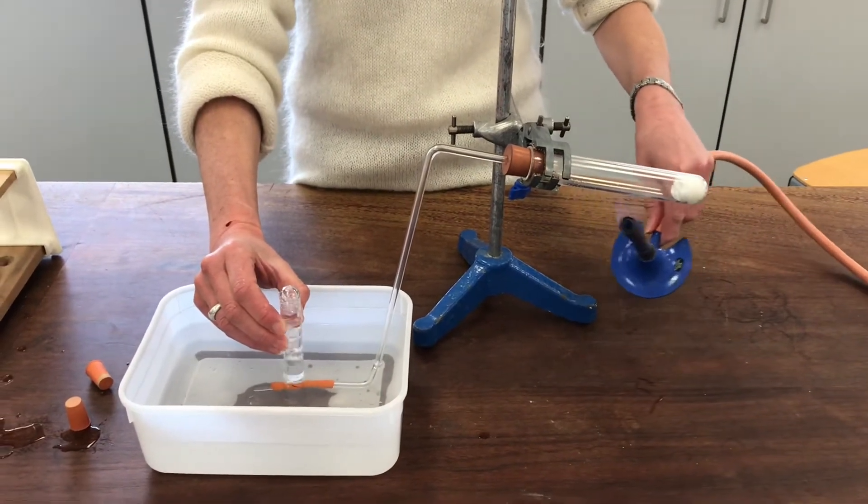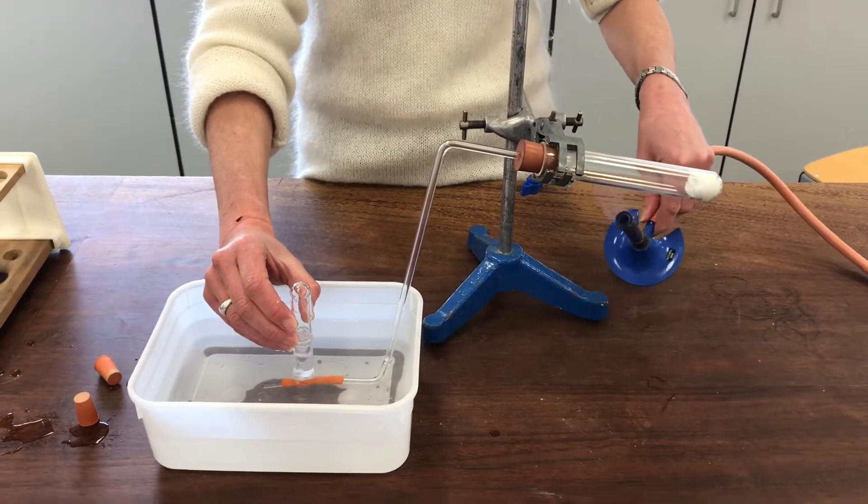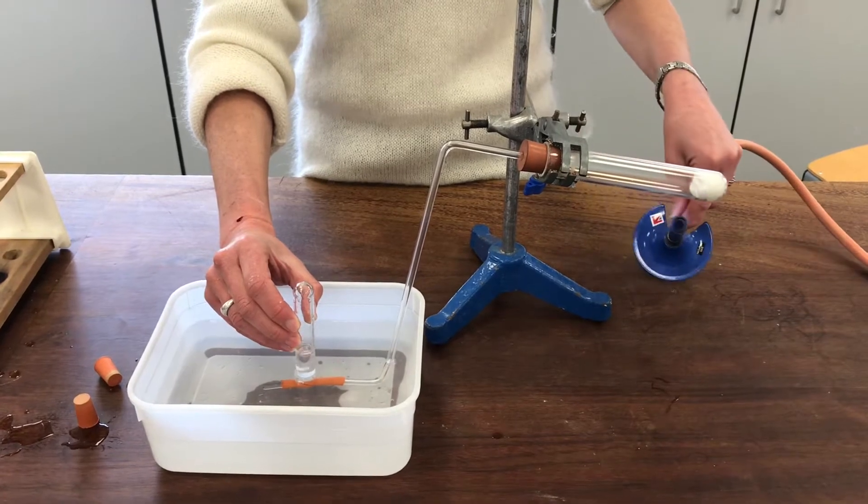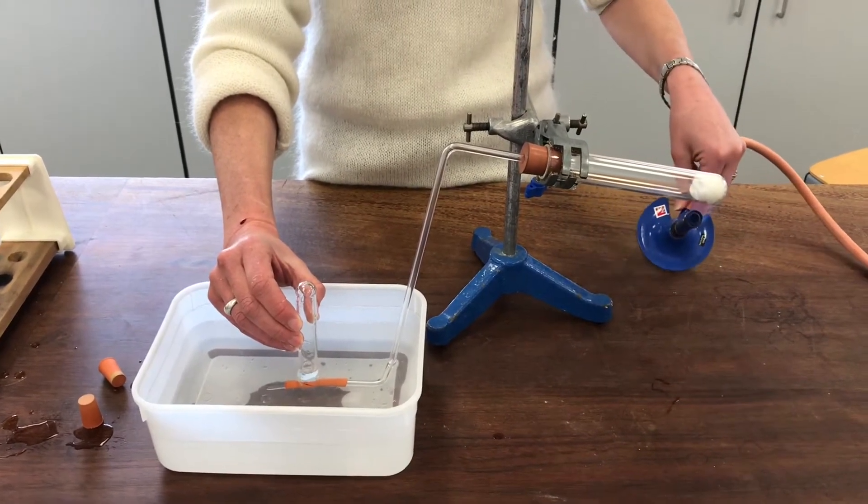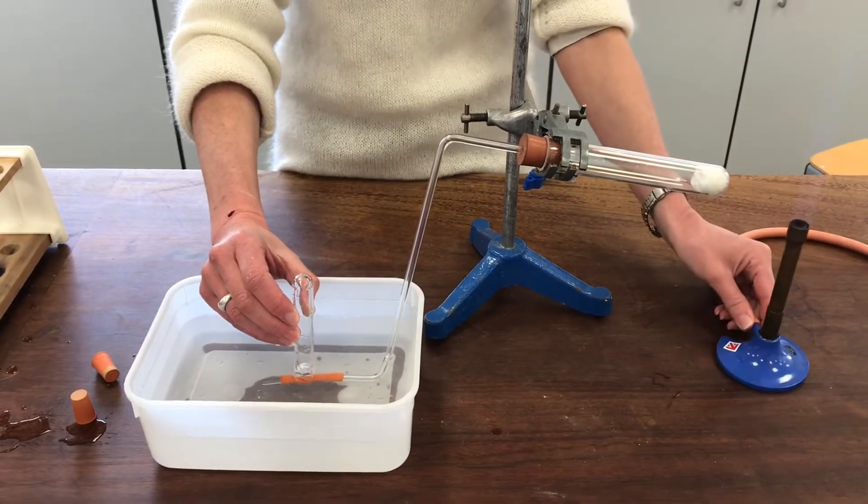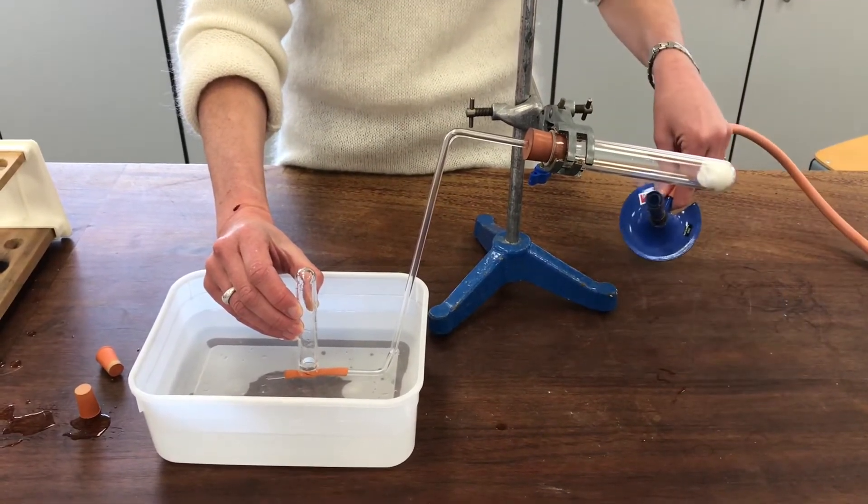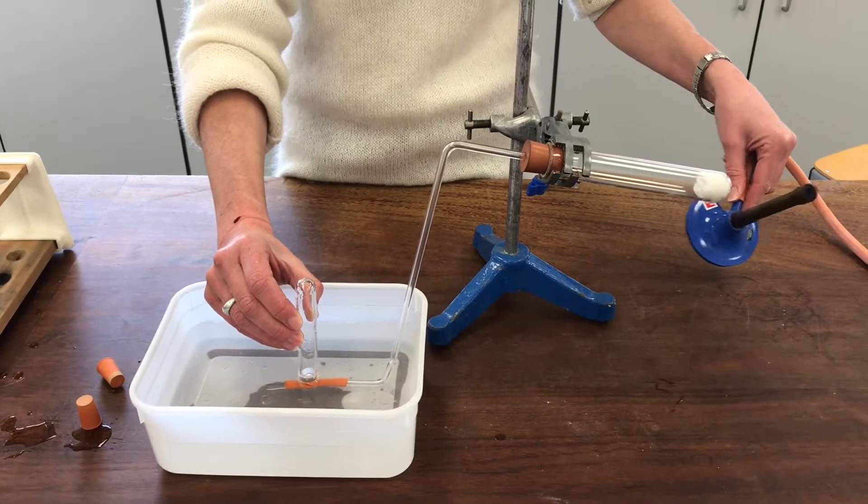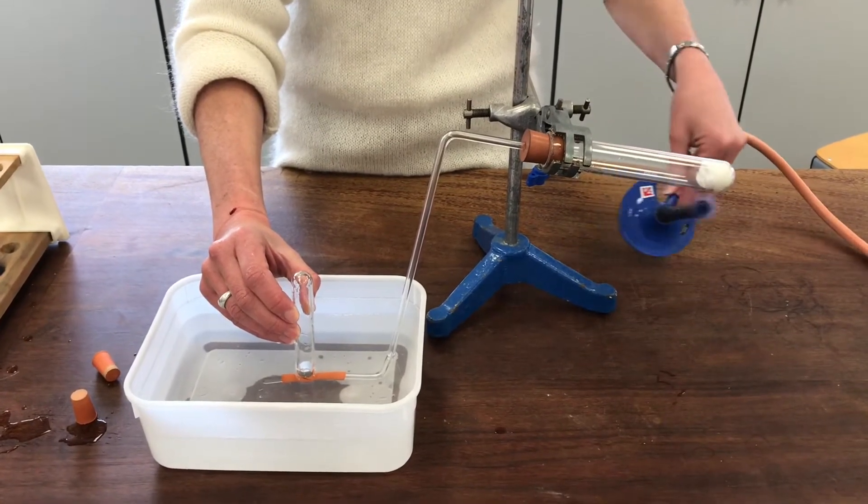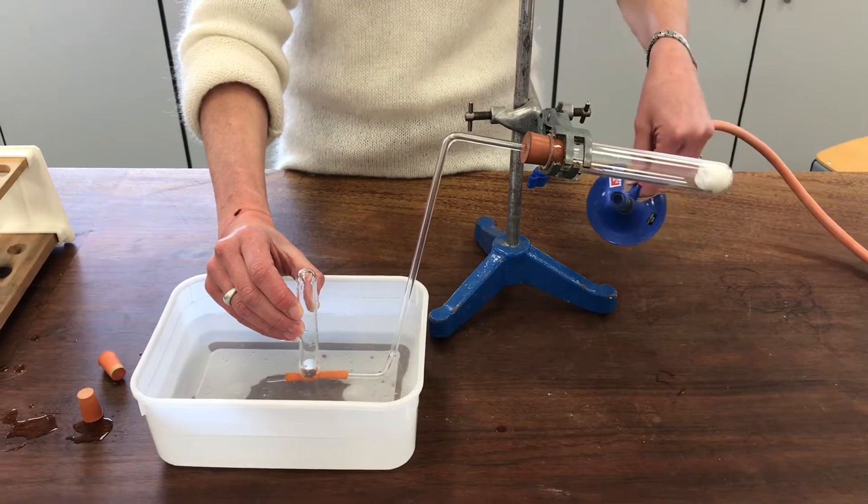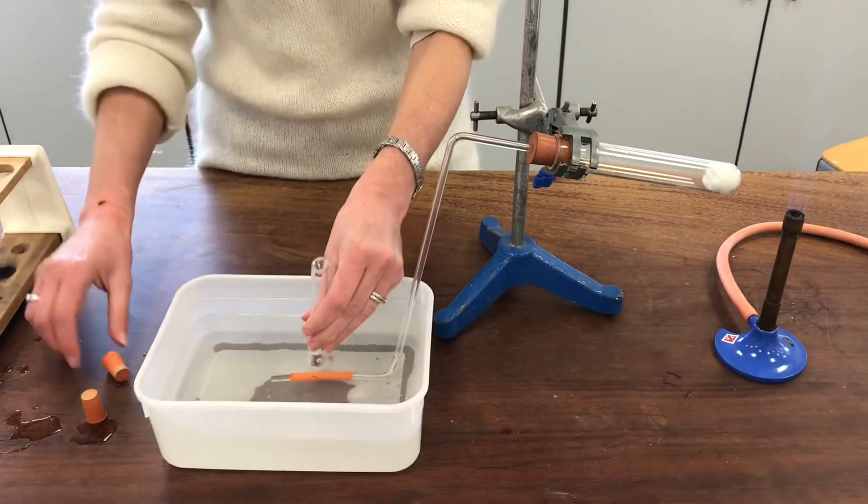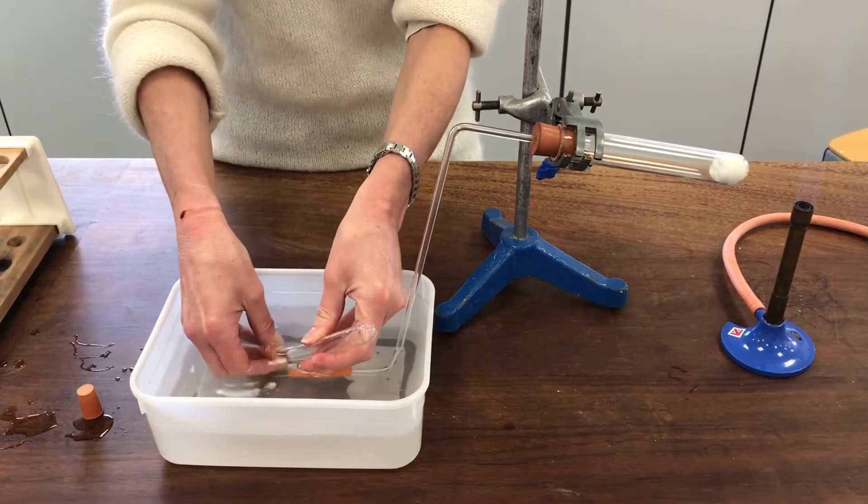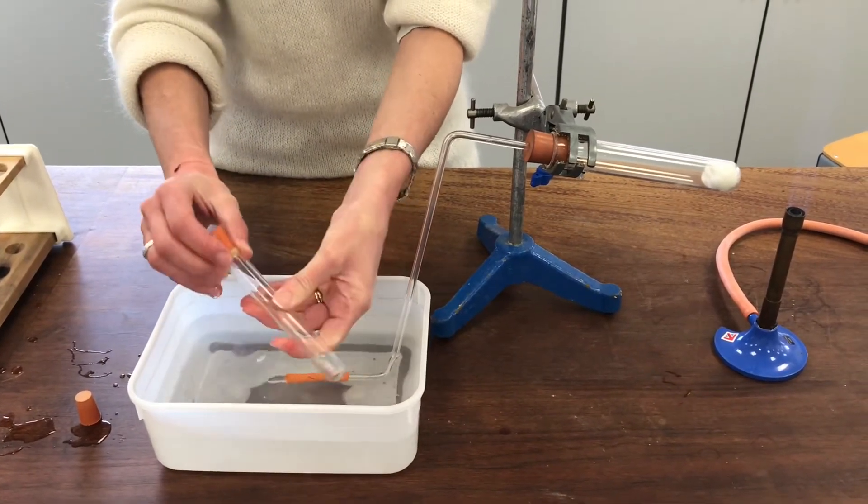I want to try to be fairly cautious with this so it doesn't suck any water back. Okay, it's a second tube of gas collected. Let's try a third one.